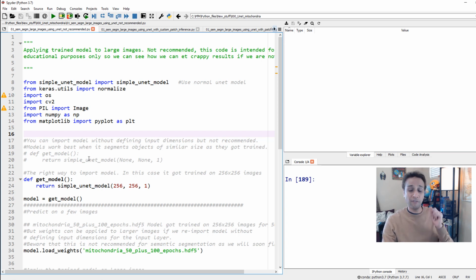What we did in the first video when we did this unet was actually train a unet and save a trained model. And we trained it on patches of 256 by 256. These are grayscale images, so I divided a large data set into small patches and then trained the unet on this size patches.